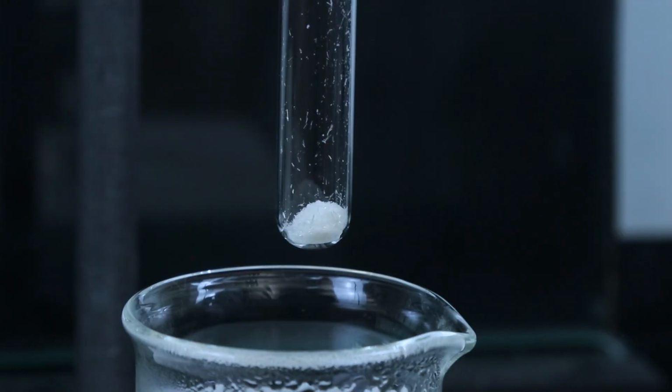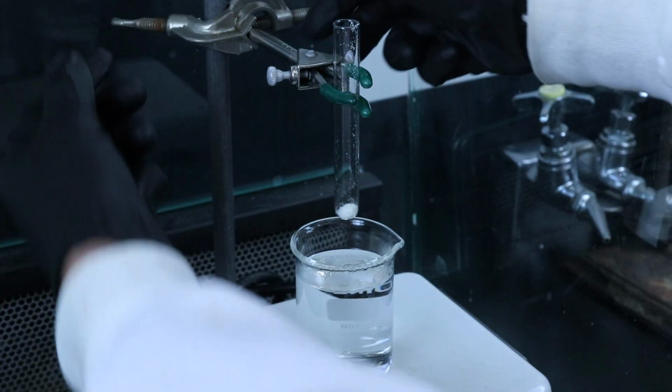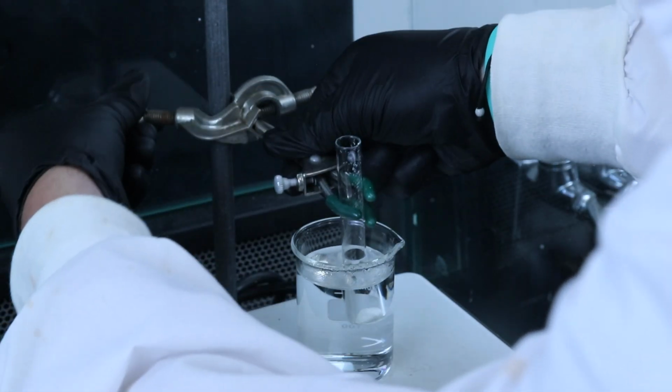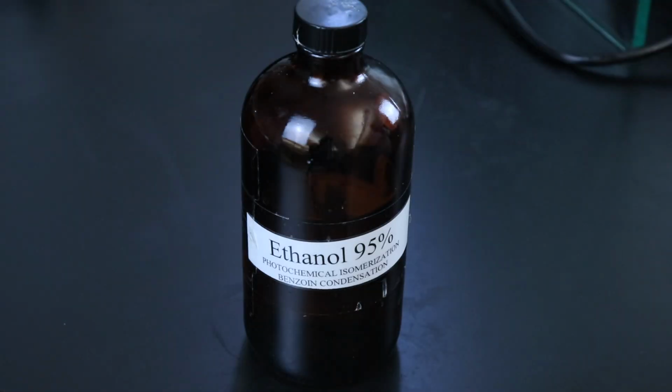And you'll want to use one of these tubes because they are made to withstand more drastic temperature changes without cracking, whereas if you use a beaker or a conical vial, those could break upon transferring them from the hot water bath over to the ice bath. Once the product is in there though, you can place the test tube or the Craig tube into the hot water bath and start getting the solvent that you'll be using to dissolve the solid.